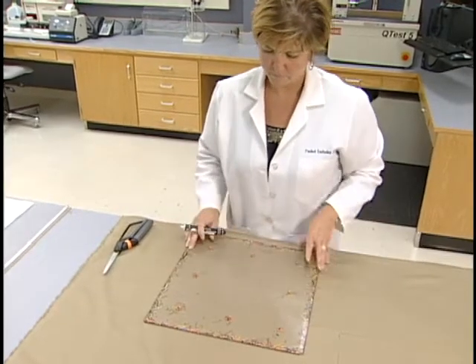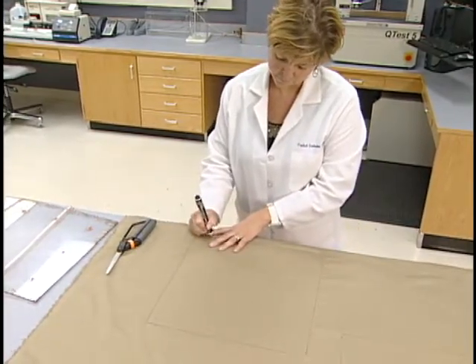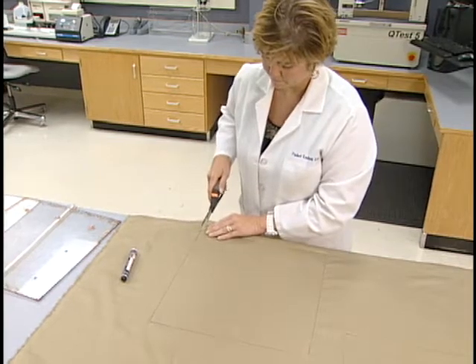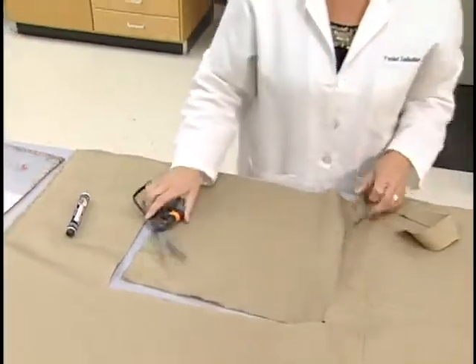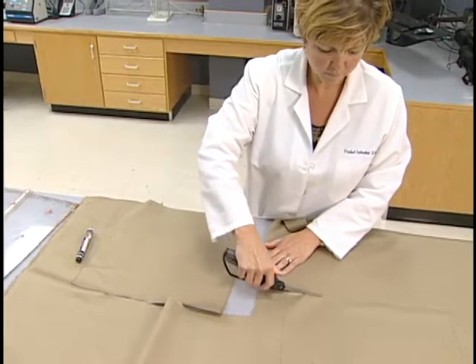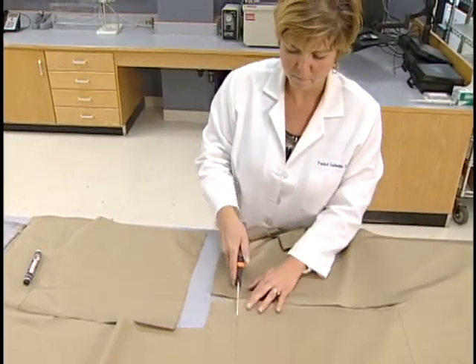In addition to the standardized equipment and detergents, the test method requires standard-sized samples and ballast fabric. Three representative fabric specimens of about 15 by 15 inches, 38 by 38 centimeters, are cut parallel to the fabric length and width. Each specimen should contain different groups of lengthwise and widthwise yarns. The specimens should be marked to indicate the lengthwise direction. If fraying is expected in laundering, the edges of the specimen should be hemmed with a specified sewing stitch.